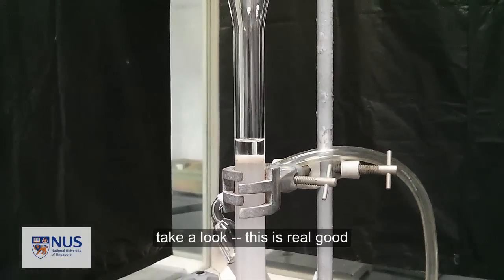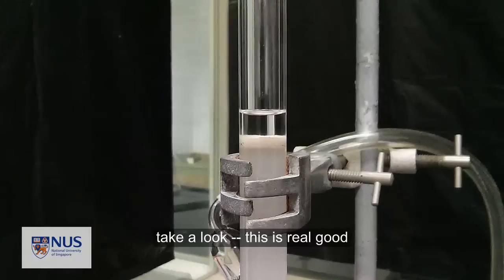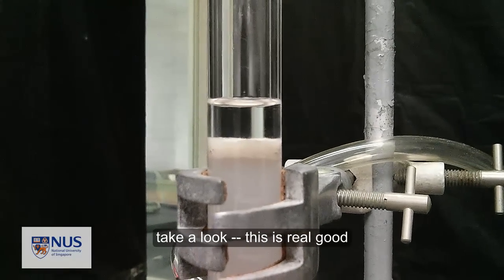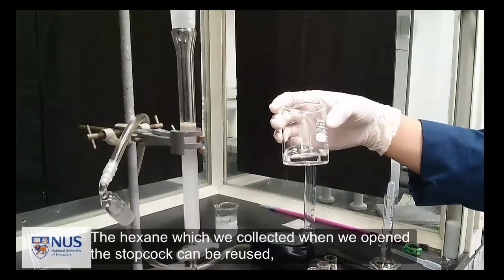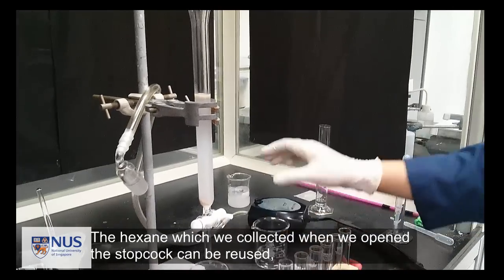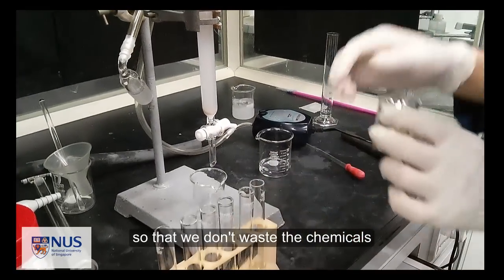Look at this. This is good. The hexane which we collected when we opened the stopcock can be used so that we don't waste the chemicals.